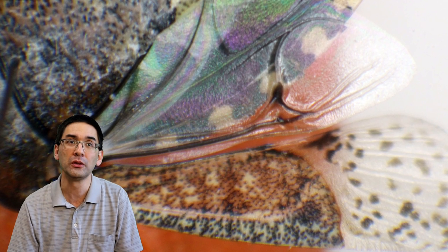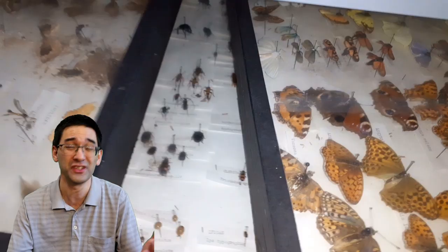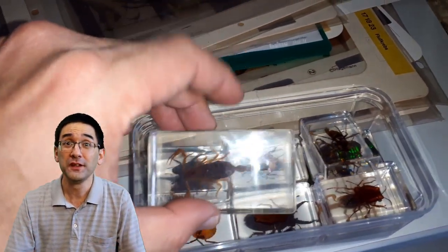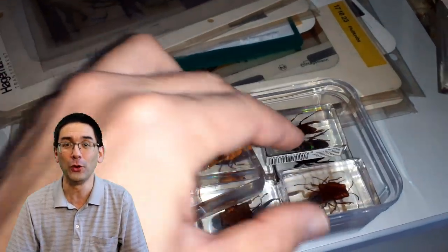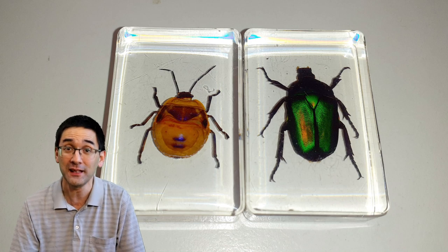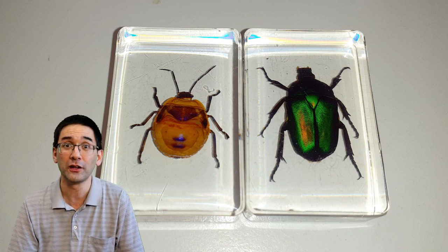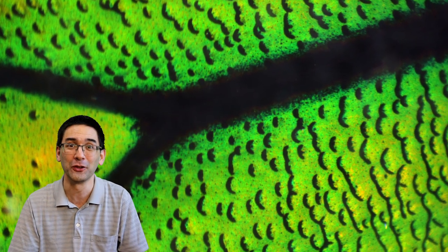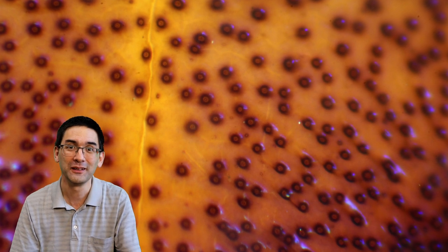Unfortunately some of them have accumulated a little dust, which does not make the insect appear quite as nice. You also don't want to look at insects that are decaying or decomposing — that's a health issue too, so you don't want to touch those. Alternatively, you can buy prepared insects cast in plastic, which can also be observed under the stereo microscope and produce very nice, colorful, and beautiful results, like here.